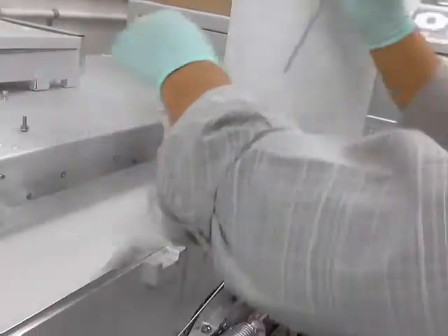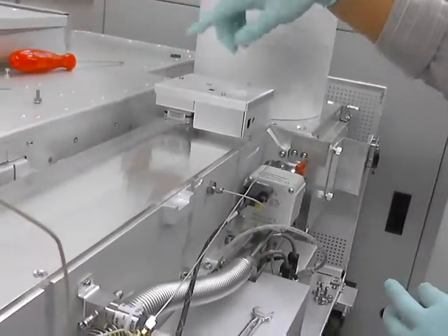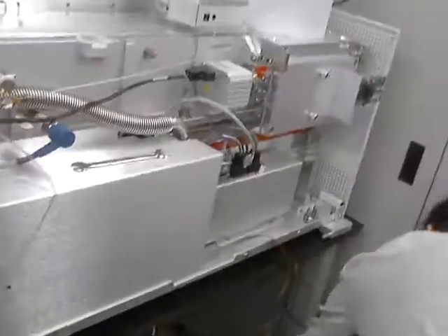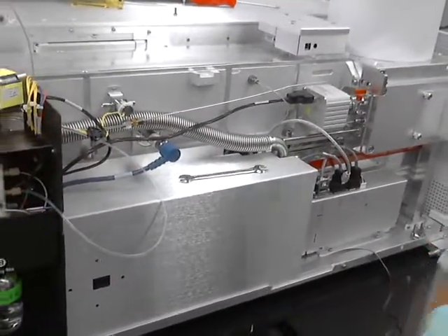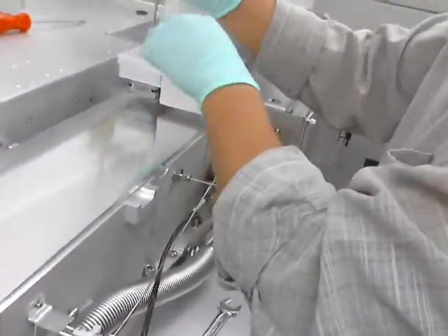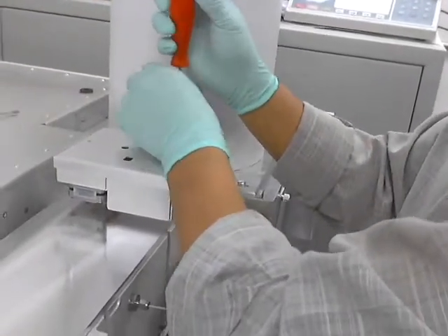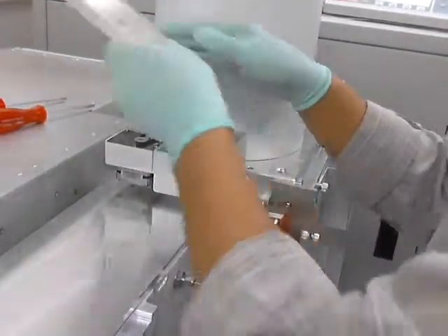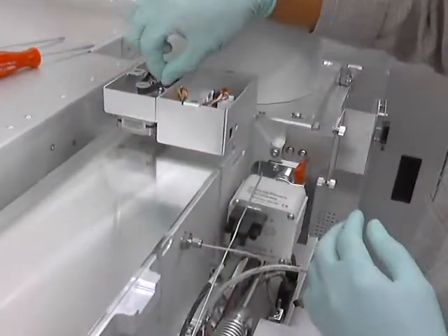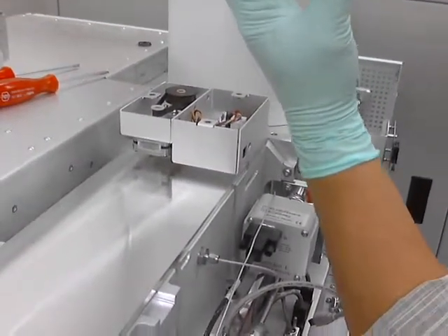You're dead in the water — this will not start up again. So before you start pumping it down, we have to turn a little belt inside. I'm just going to take this off right now, but I'll show you what I mean. It has to fit — there are a couple of gears that have to fit together. There's a belt, so this one couples, and if it's misaligned, you have to move it until it lines up.